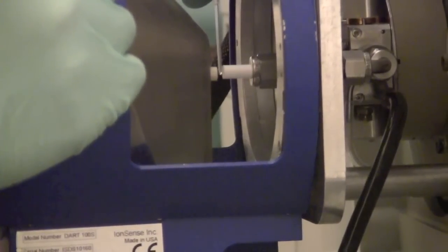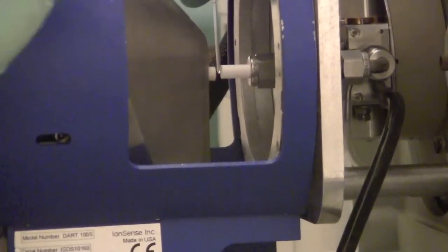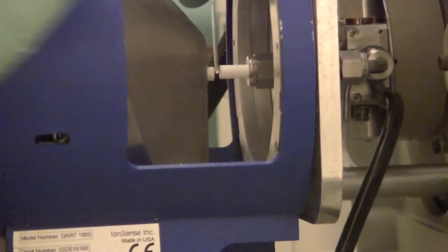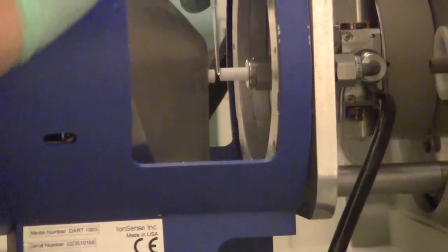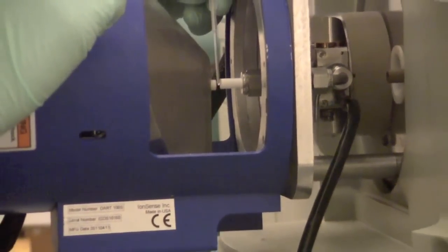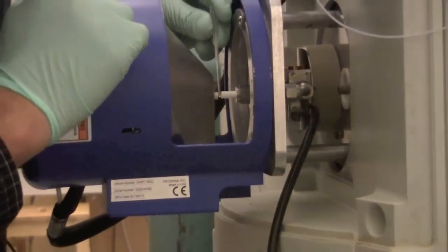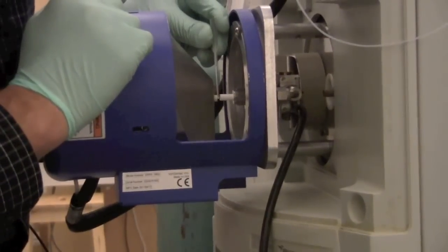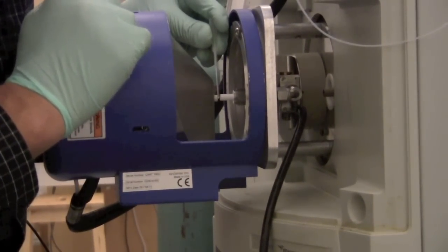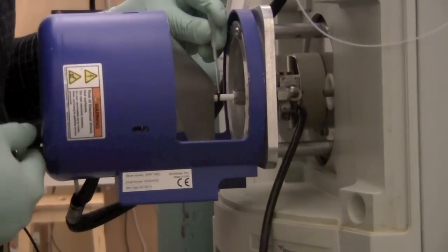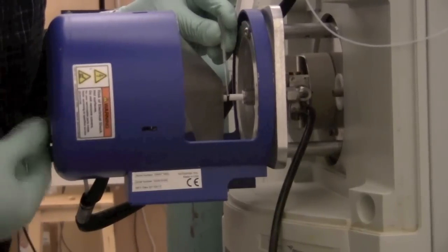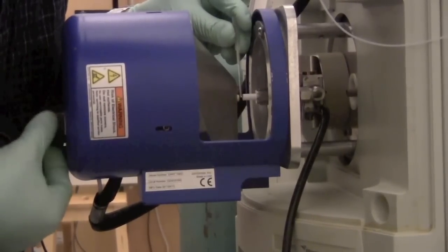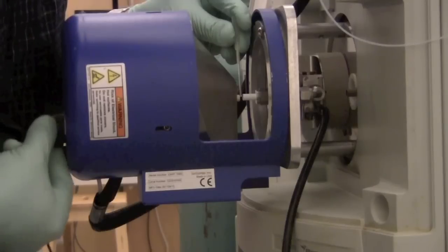We can place the capillary into the space between the source and the inlet. This will heat the sample and the helium ions will hit the sample and ionize the sample and send it into the mass spectrometer. It's a good idea to try not to touch either the source or the inlet. We don't want it to be contaminated. If you want there's a dial on the back here that can adjust the gap to accommodate a larger or smaller sample.